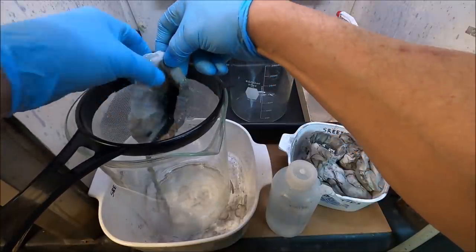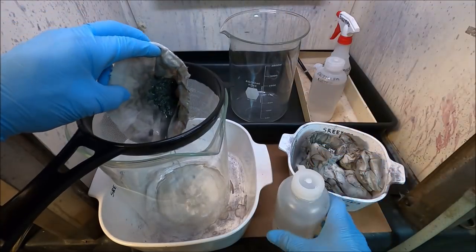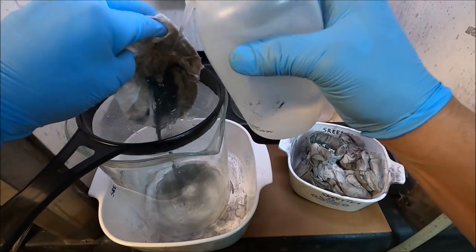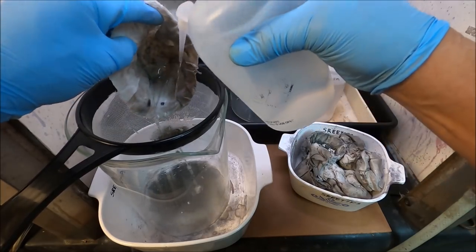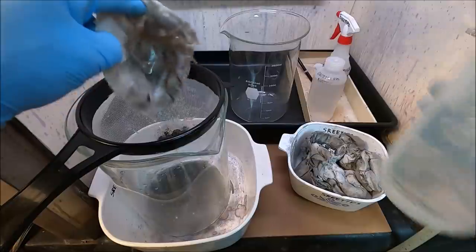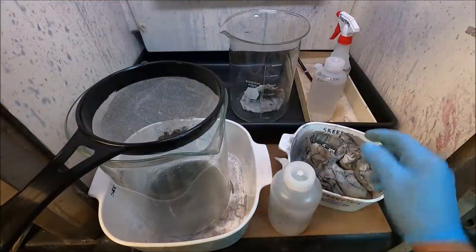As you can see, these slimes still have a little bit of metal in them, a little bit of silver. So we're going to drain all this out of here, rinse all this out of these filters as best we can, and then I'll put the filters back in this separate container.